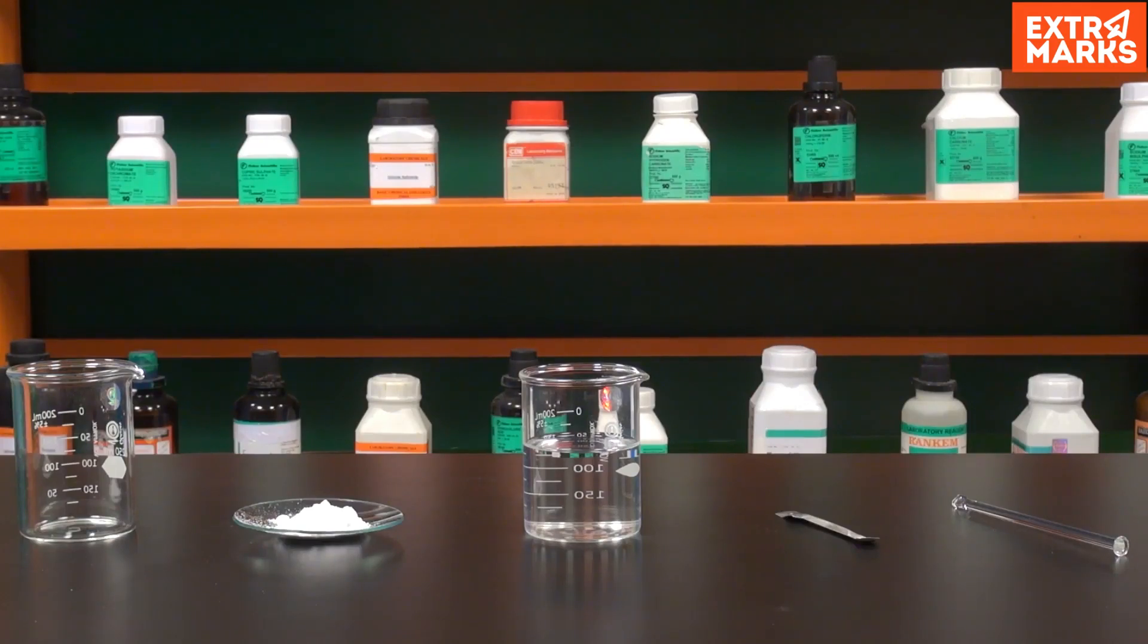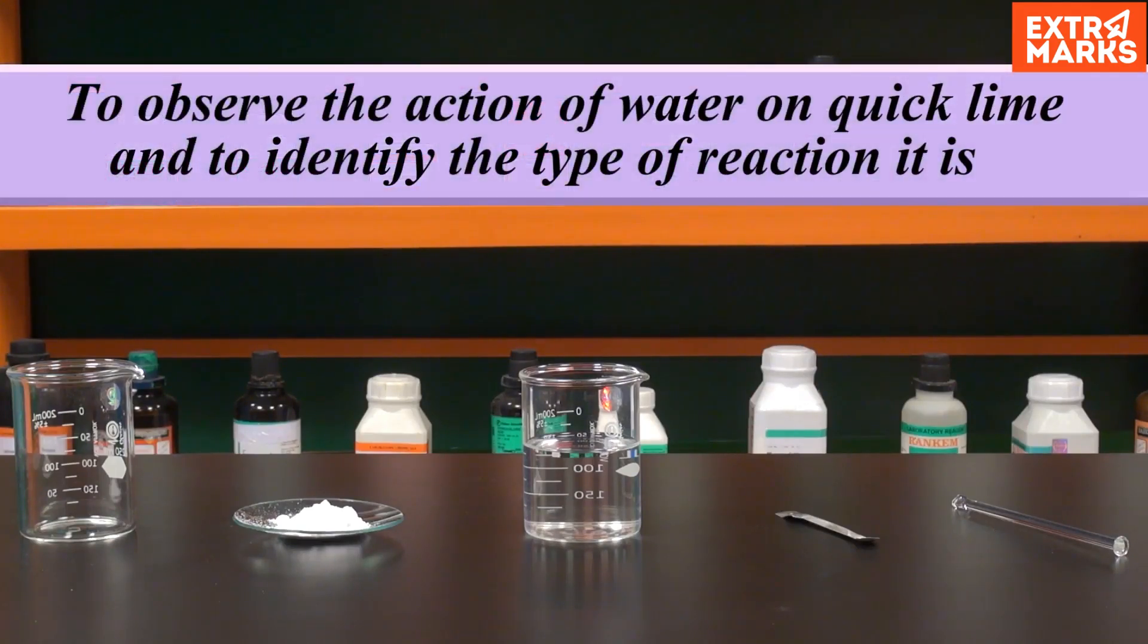Let us perform an experiment to observe the action of water on quicklime and to identify the type of reaction it is.